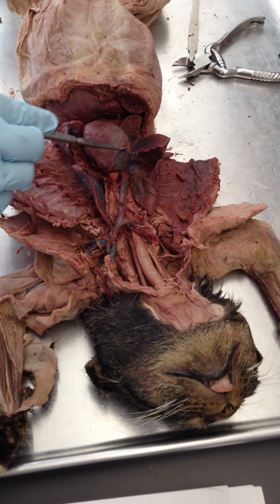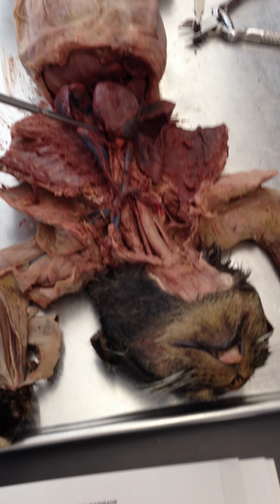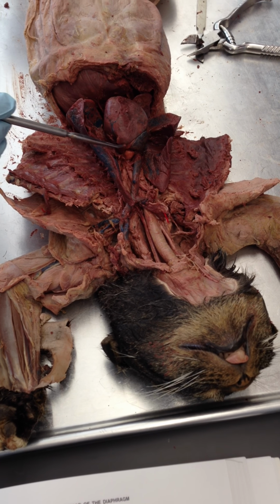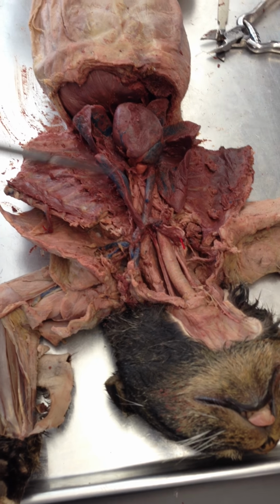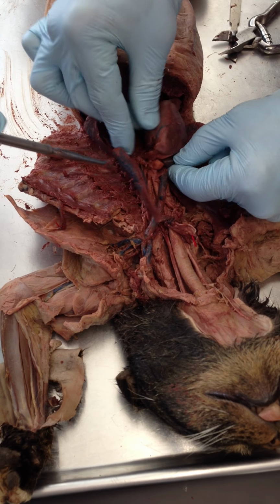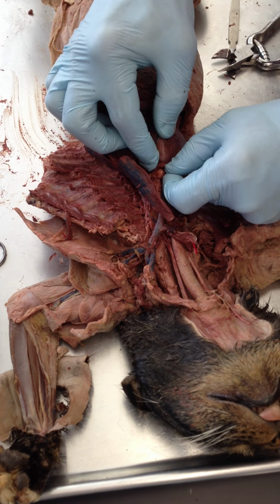That's right. Okay. Where's the pulmonary trunk? Would you show me that again? It's down here. Yep, you're actually touching it right there. And then the pulmonary artery is the one that comes off the back like that. So between the two atria, right here, you've got the pulmonary trunk and artery, right?